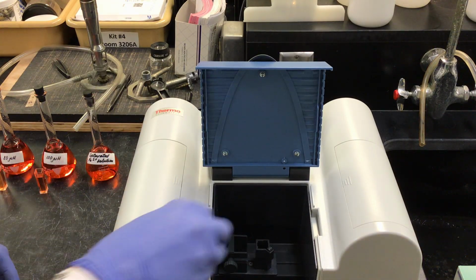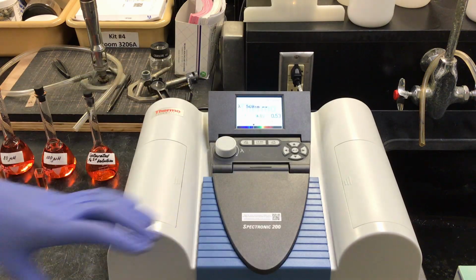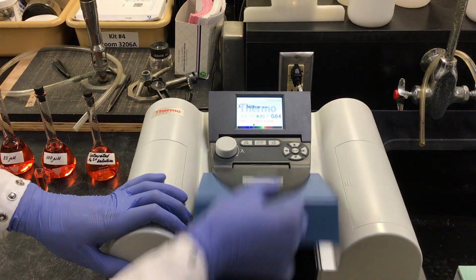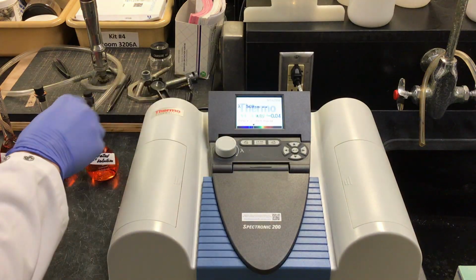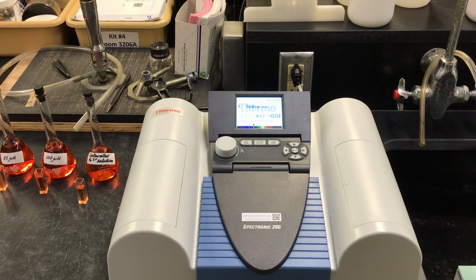Then we will use the Beer's Law plot with our now saturated iron solution, reading its absorbance at 0.64. And so now we can go ahead and find out the concentration of our saturated solution that we diluted in our volumetric flask and work our way back in order to find our concentration of our true iron oxalate solution.